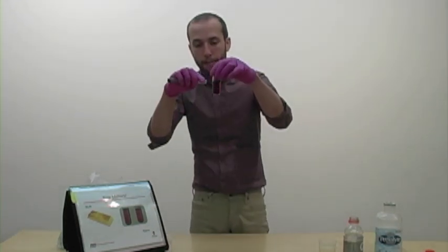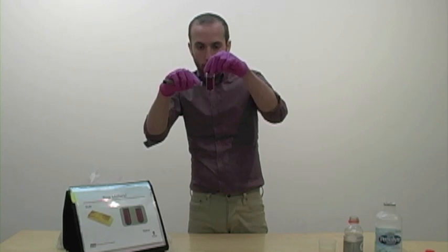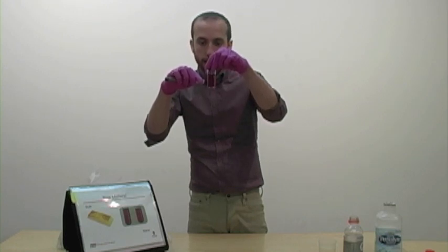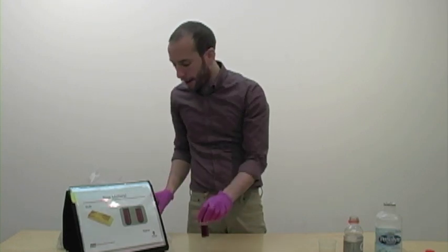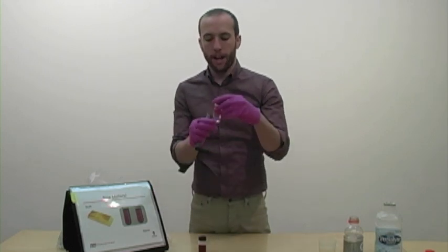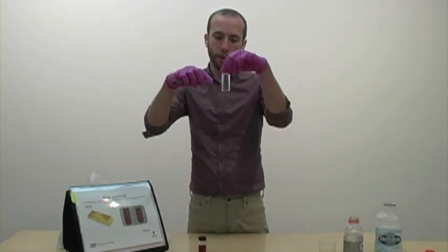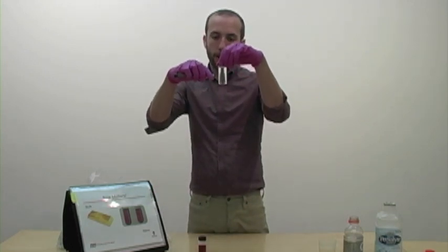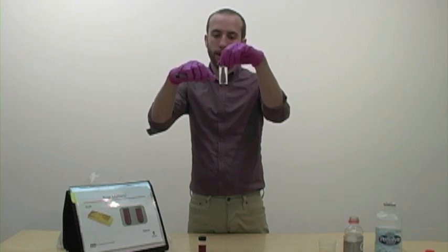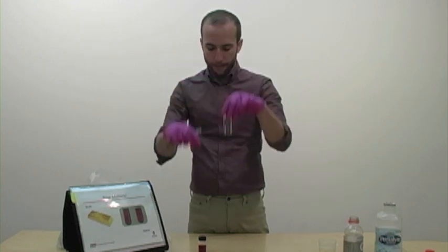So if I lift the laser pointer up, you can see all of the little particles that the laser bounces off of. So in comparison, if I have this vial just full of water using as a control, there's nothing in there. There's no particles of solid in there, so there's nothing for the laser to bounce off of.